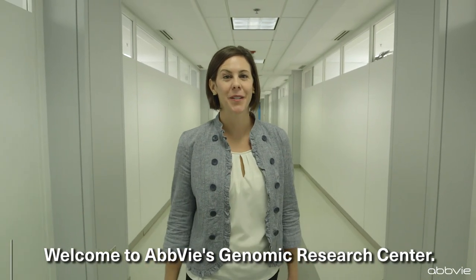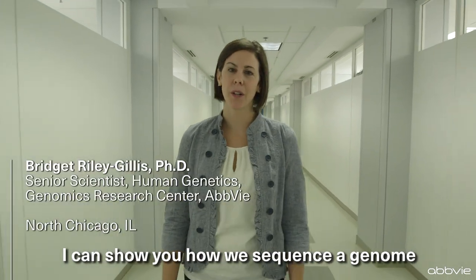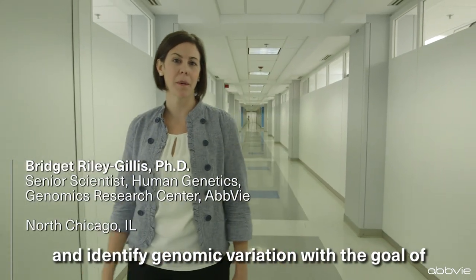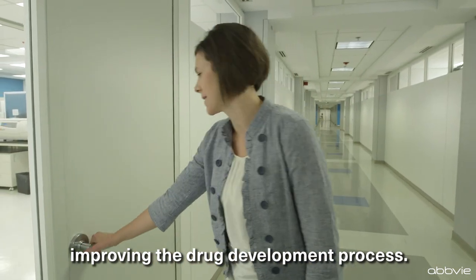Welcome to AbbVie's Genomic Research Center. Let's follow a DNA sample through the lab so I can show you how we sequence a genome and identify genomic variation with the goal of improving the drug development process.